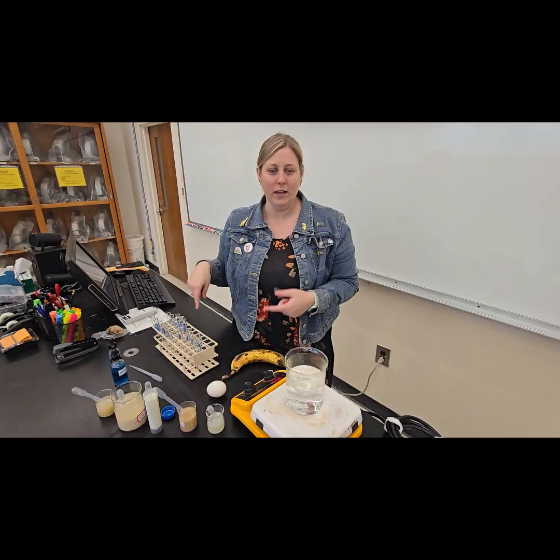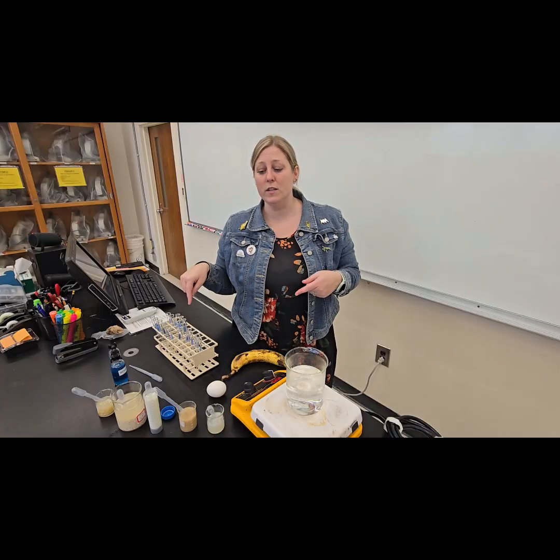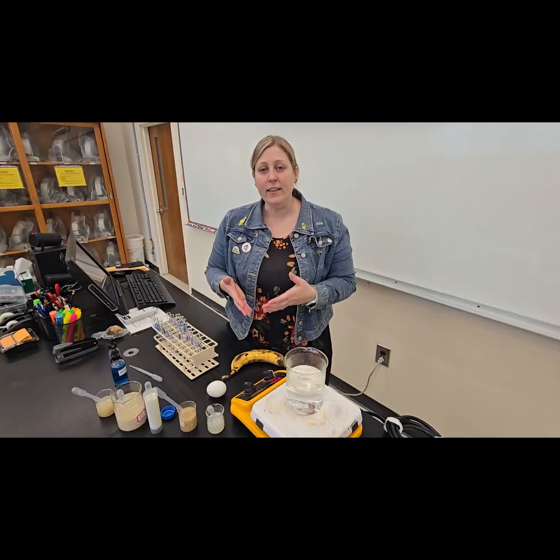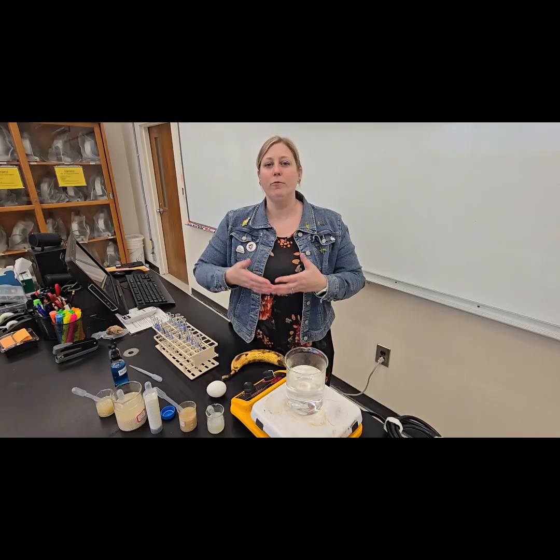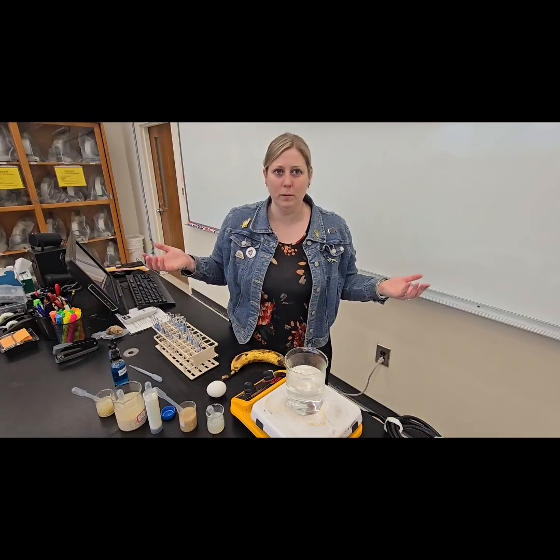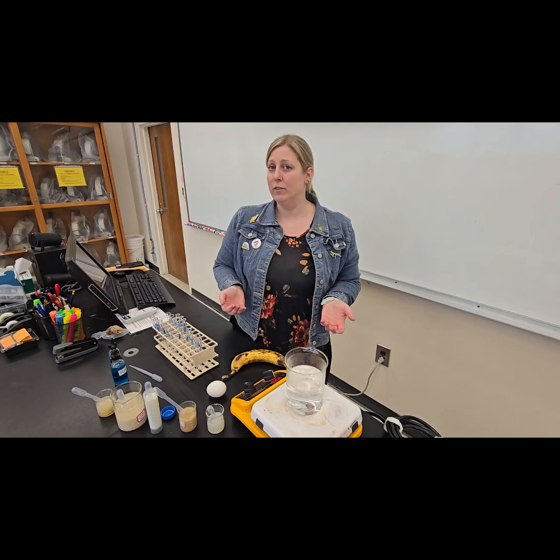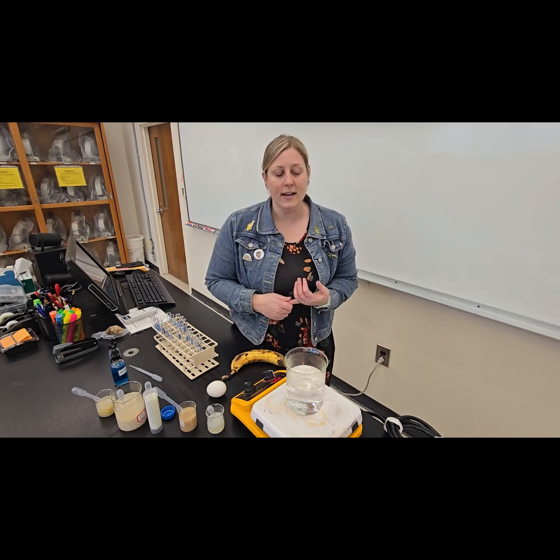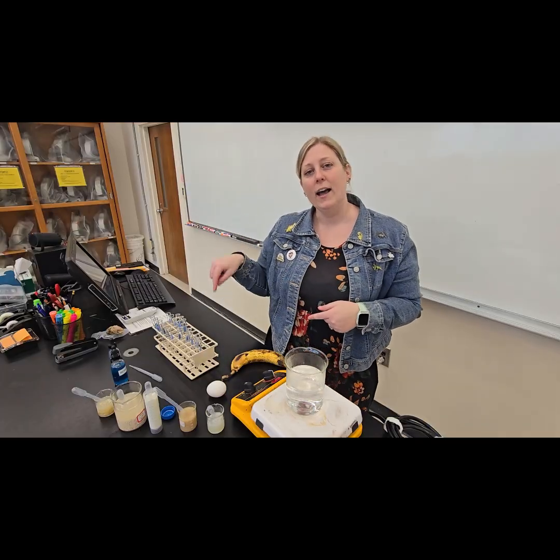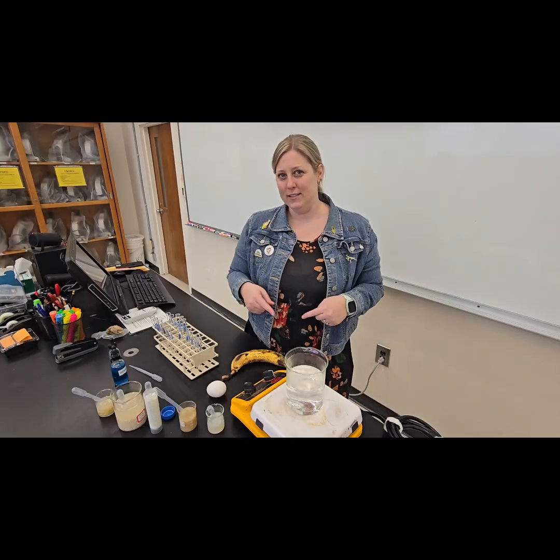You're going to pause the video while I get this set up, and you are going to write a hypothesis for each of these, for each of the solutions we're testing. So you should say, I think egg white is going to have blank of these. So maybe you think egg white is going to have starch for some reason. So you'd think that egg white would have a positive result for starch and maybe a negative result for glucose. You're going to write that down in the hypothesis section of your table, and then you're going to come back and we're going to see what those results actually are. Okay? Go write your hypotheses now.